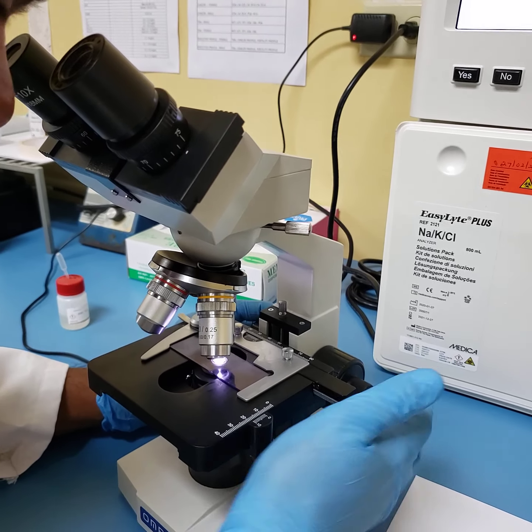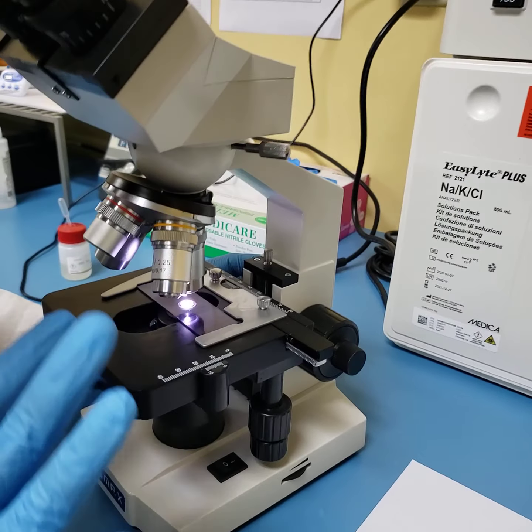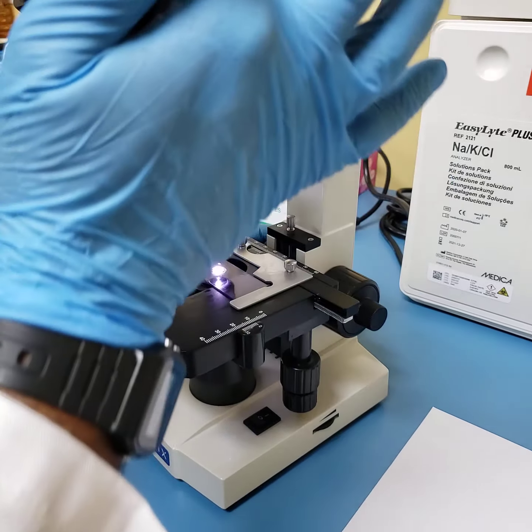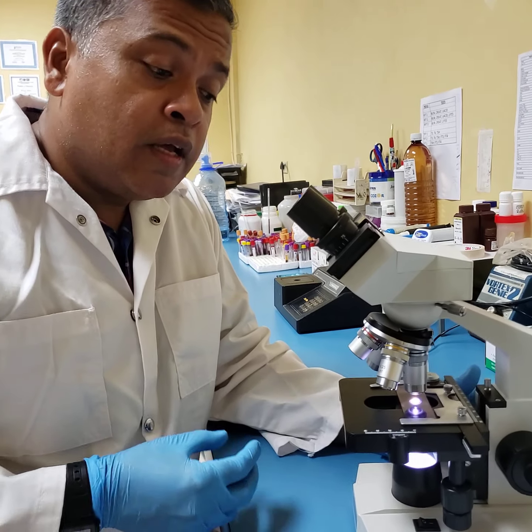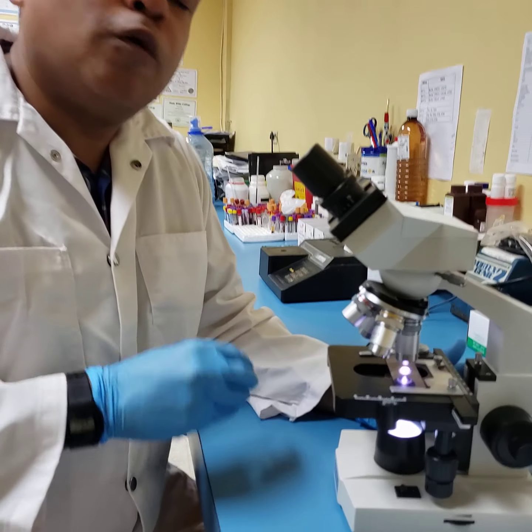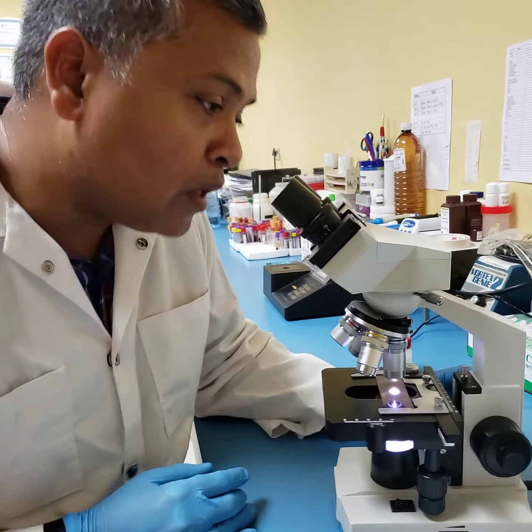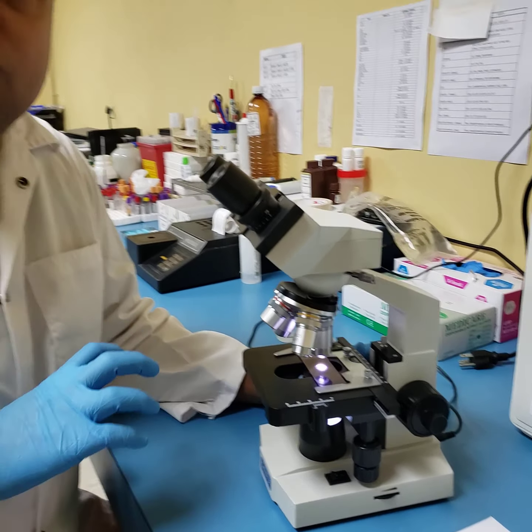knob and you bring your stage up, what happens is, because the lens is so long, somewhere very soon that lens is going to come in contact with the slide, and if you are focusing here and you're using your coarse adjustment knob, you will actually impact your slide. Your slide could break, a very important smear could be lost, and then you can also damage the lens in your microscope. This is not the way. So you taking your stage straight down and looking at your eyepieces and turning it now upwards is not the proper way to do microscopy.